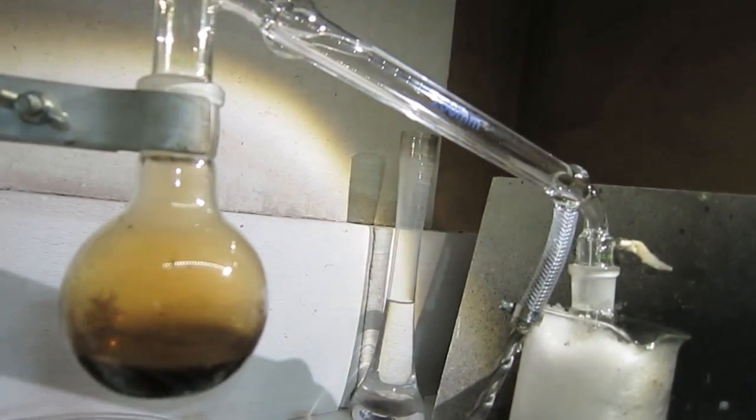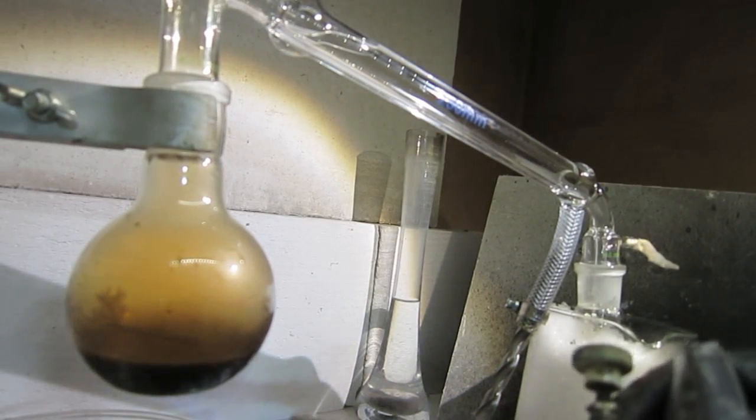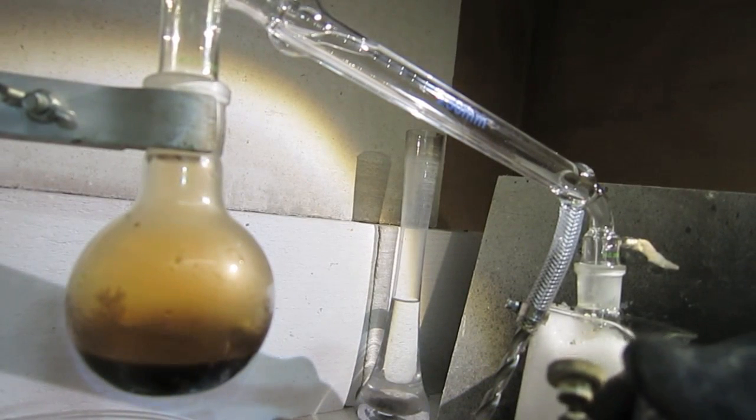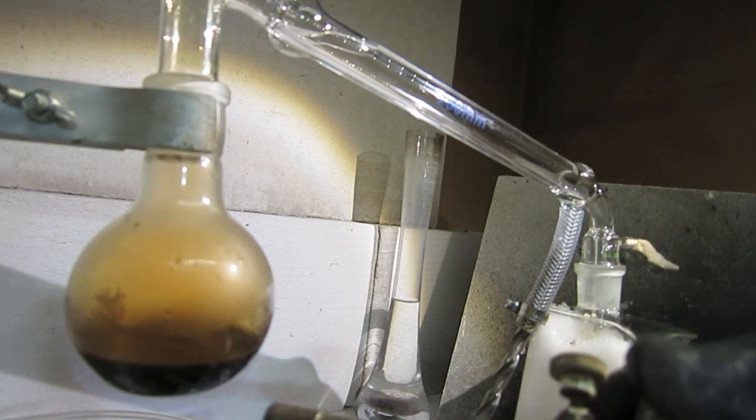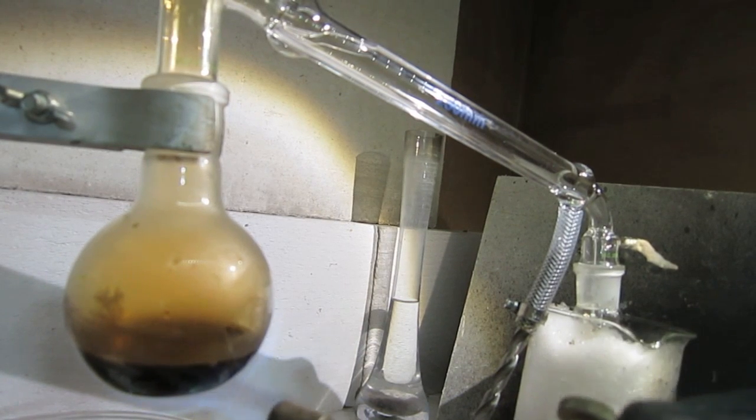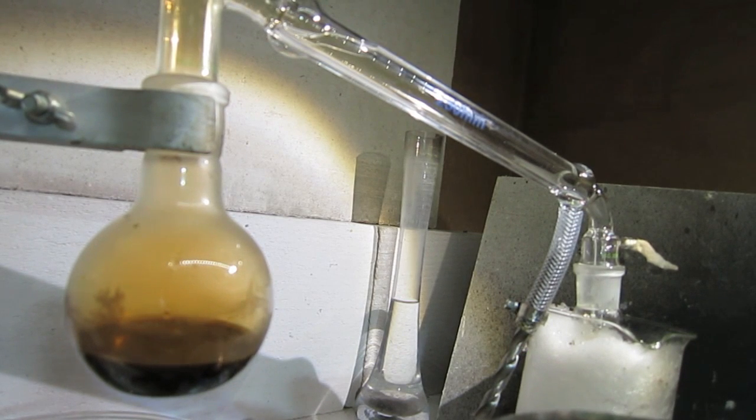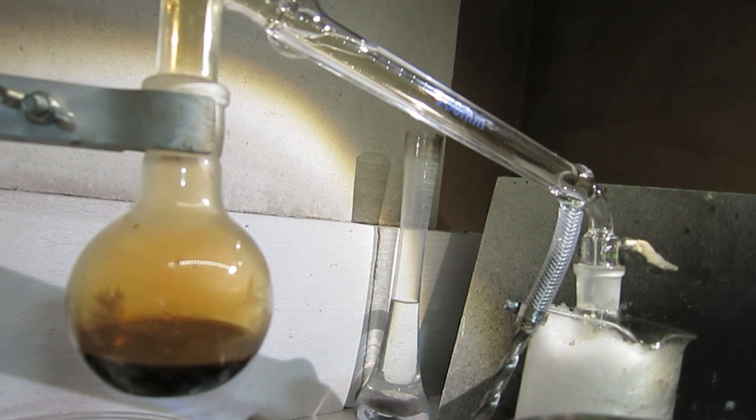Starting to very slowly heat the round-bottom flask. There's already some bromine vapor appearing, and now it's getting browner and browner.